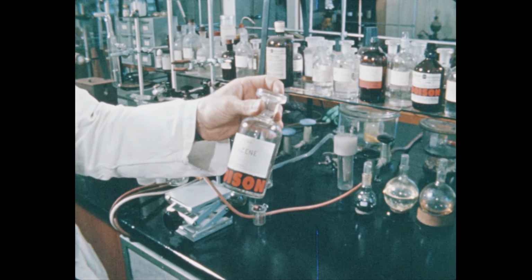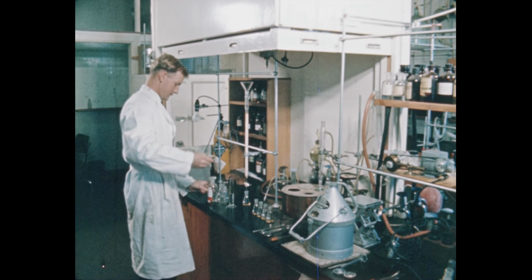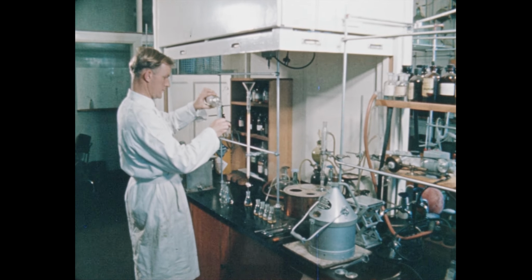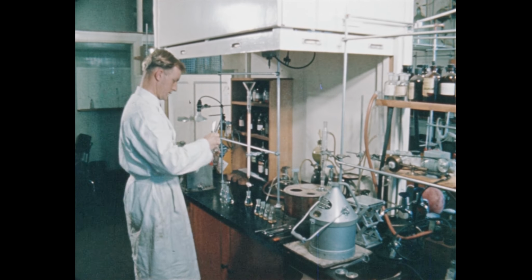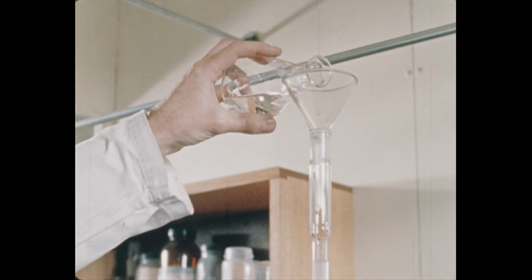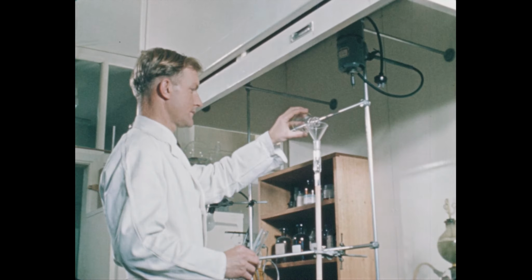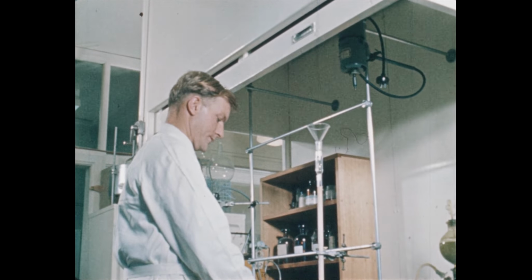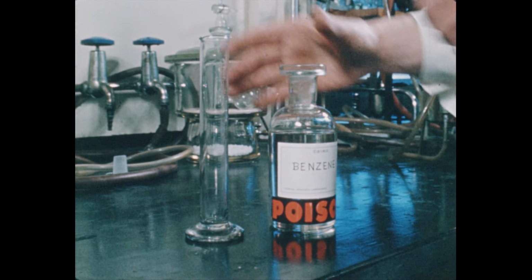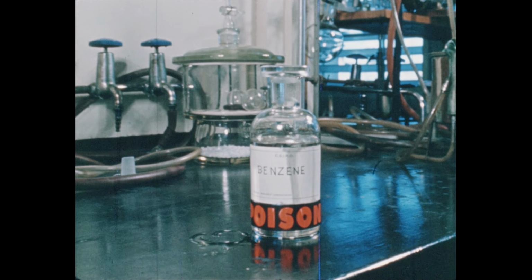Take benzene, for example. First discovered by Faraday in 1825, it's a colorless, volatile liquid having a characteristic odor which isn't unpleasant. Used a lot in laboratories, this solvent is highly poisonous, and its toxic effects demand the utmost caution in its use. Danger level rises when the liquid is allowed to evaporate and is breathed in with the air.